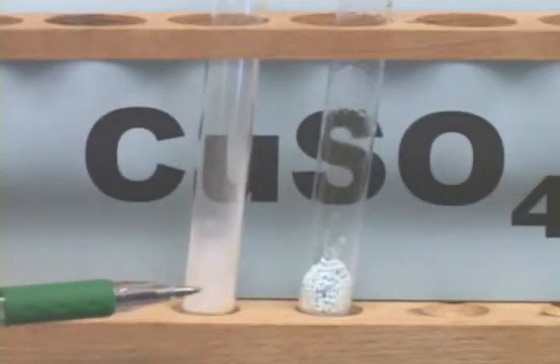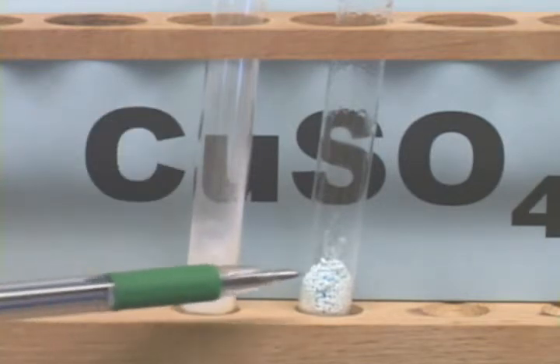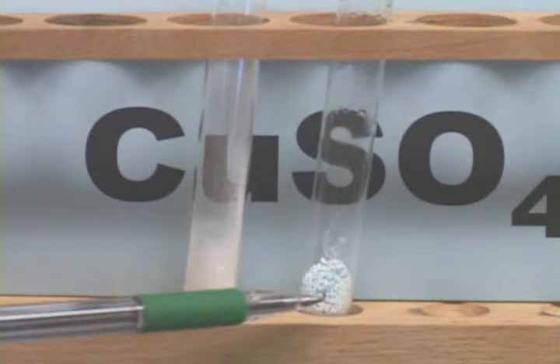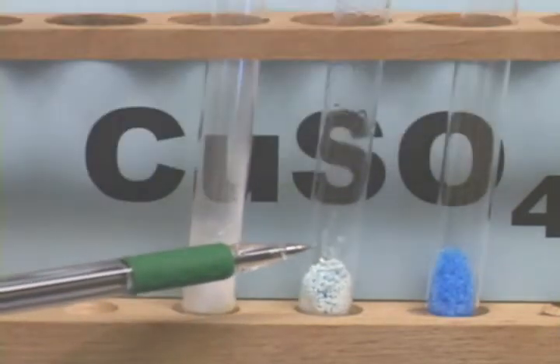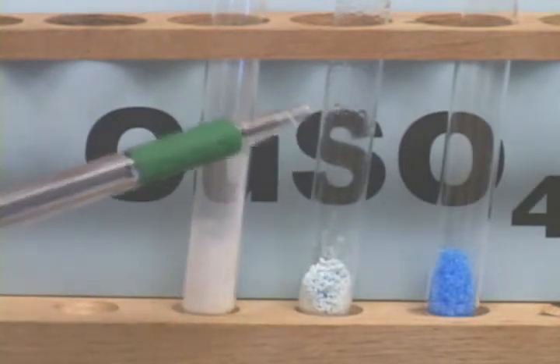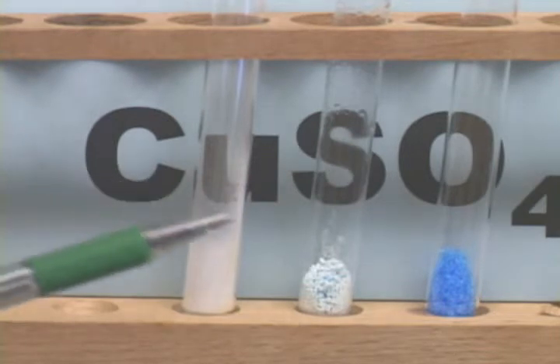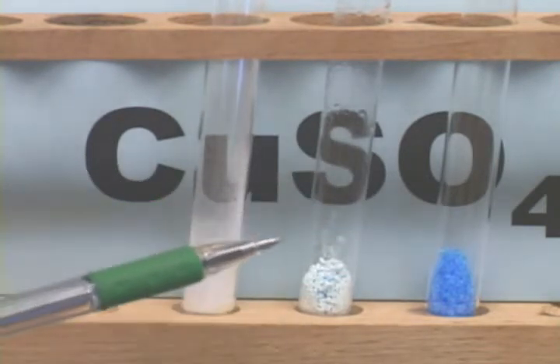Well, this first tube, when we heated it, essentially gave off no water and stayed pretty much the same, whereas the second tube seems to have changed color. We have another sample here of the original, and you can see it changed color quite a bit and gave off lots of water. Now, since the water could not come from anything other than this being a hydrate, this must be a hydrate.